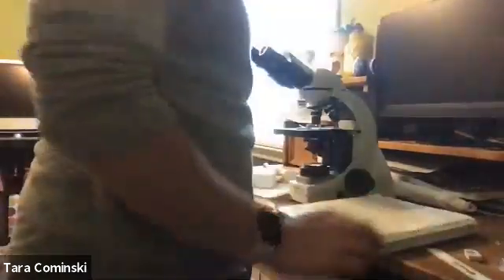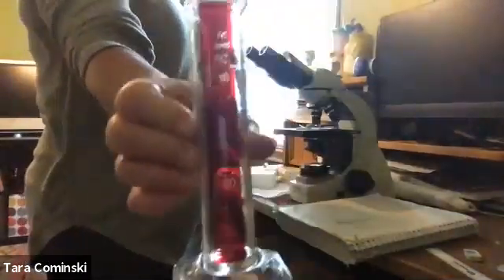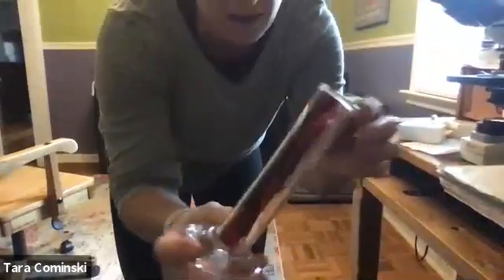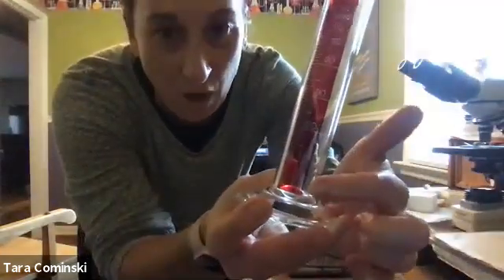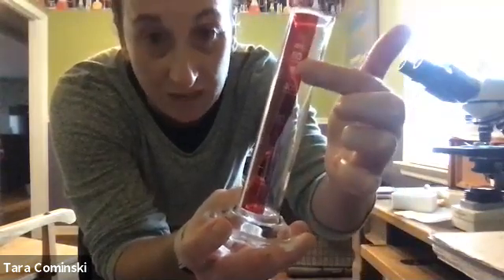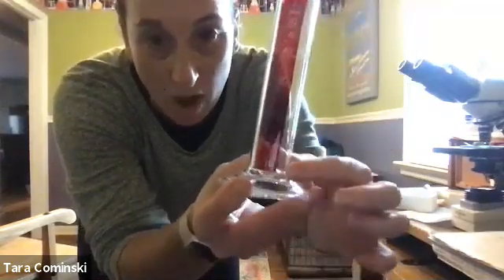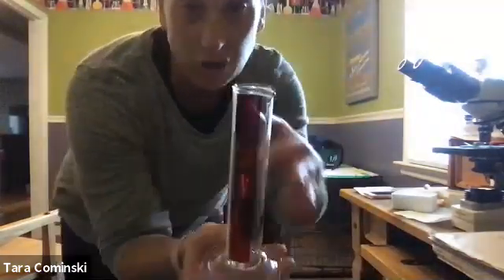Okay, and now we're going to talk about volume, right? So this graduated cylinder is one of the ways we measure volume, okay? And I apologize if it's kind of hard to see. Let me see if I can kind of get it. It's kind of hard to see the numbers there, right? But you can see in red there are volumes, right? So this is 10 milliliters, 20, 30, 40, 50, okay? And then you can see there's little tiny lines there that are just 1 milliliter each, okay? So this is what we would use to measure volume, okay?